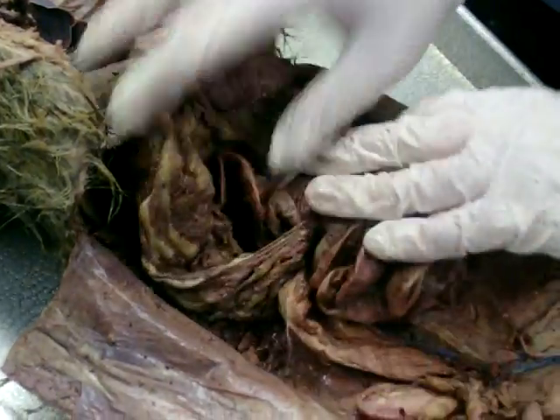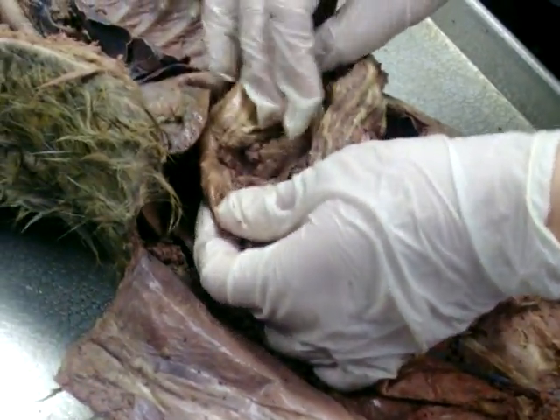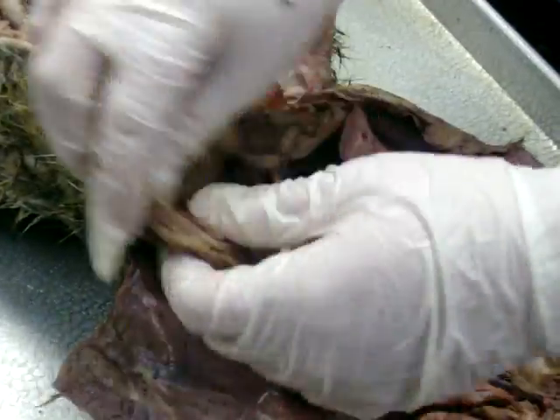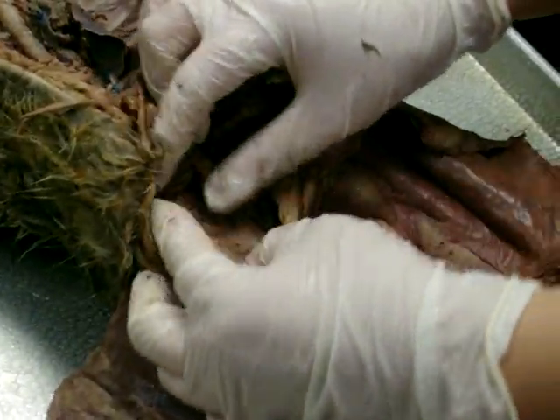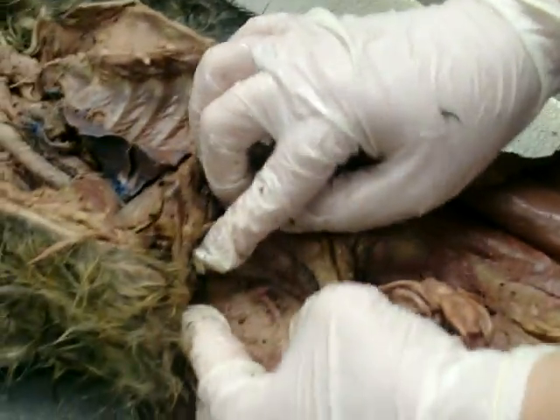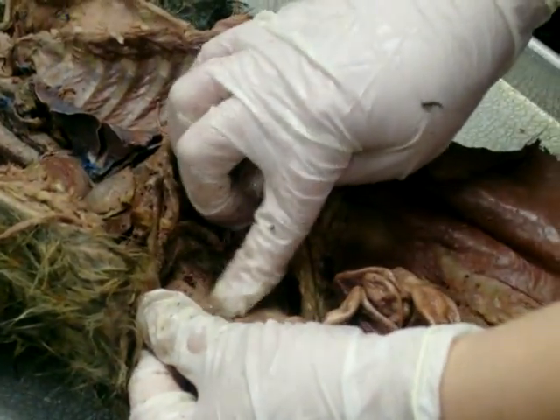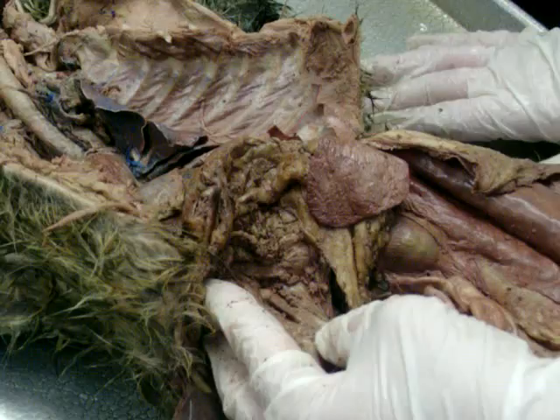Okay. So what is the sphincter at the bottom of the stomach? Pyloric. Okay. And what's the first part of the small intestine called, where it connects to the stomach? Duodenum. Right. Okay. And the pancreas, he needs to be rinsed out. But on the back of the duodenum, you can see this chunky kind of white stuff, where the membrane's not clear, but it's got this white gooey stuff. That's actually pancreas. Okay.